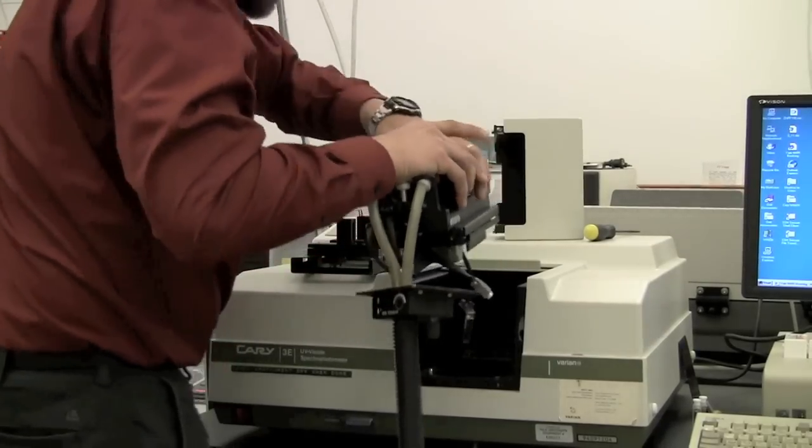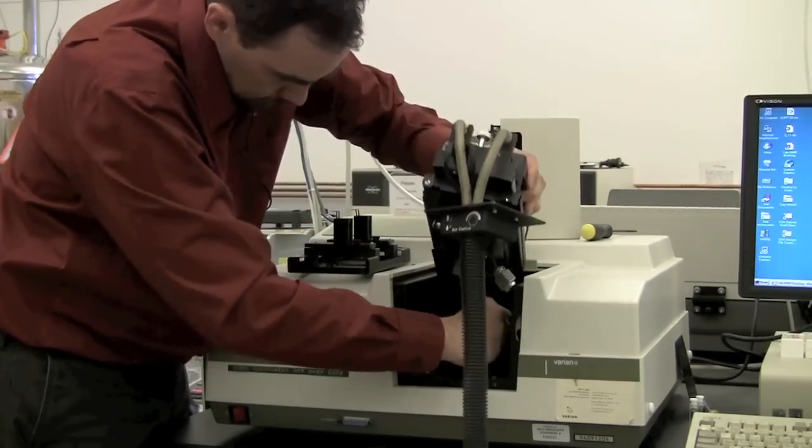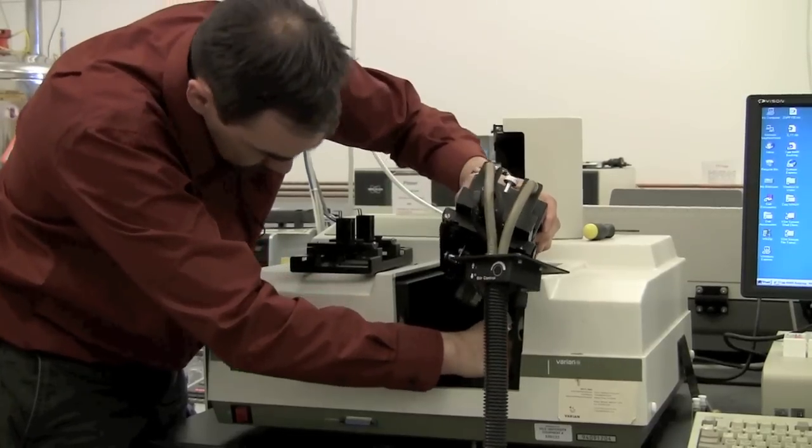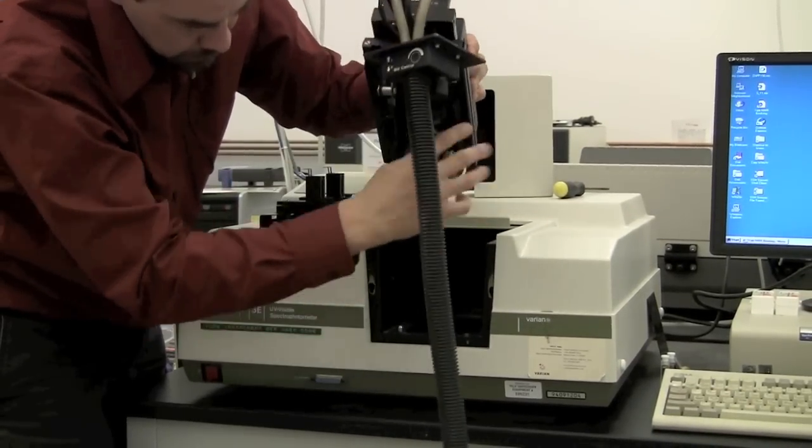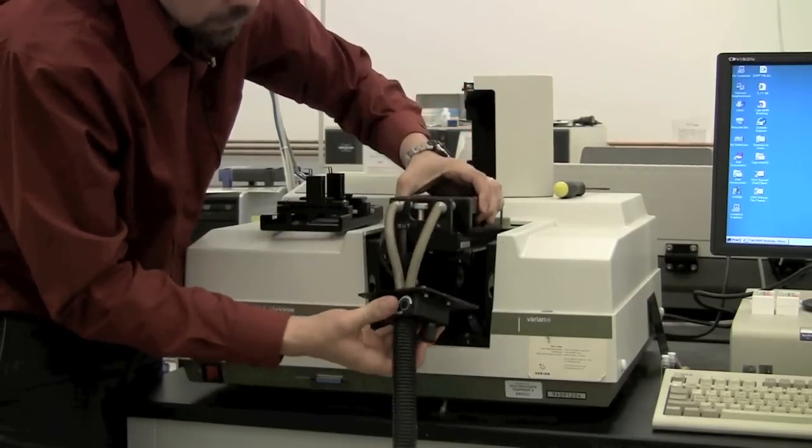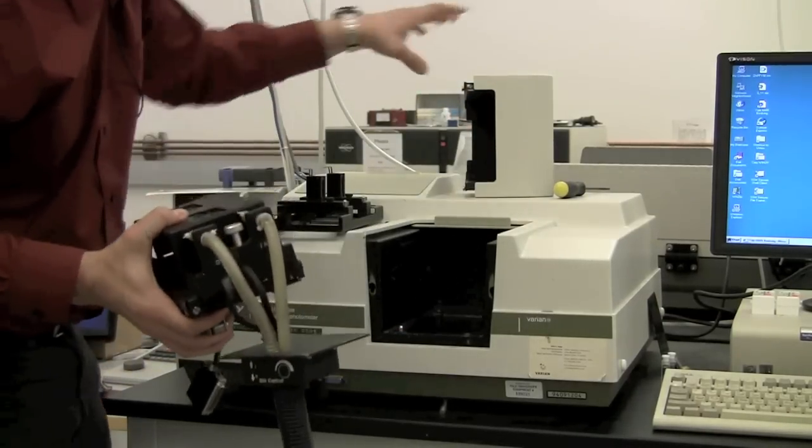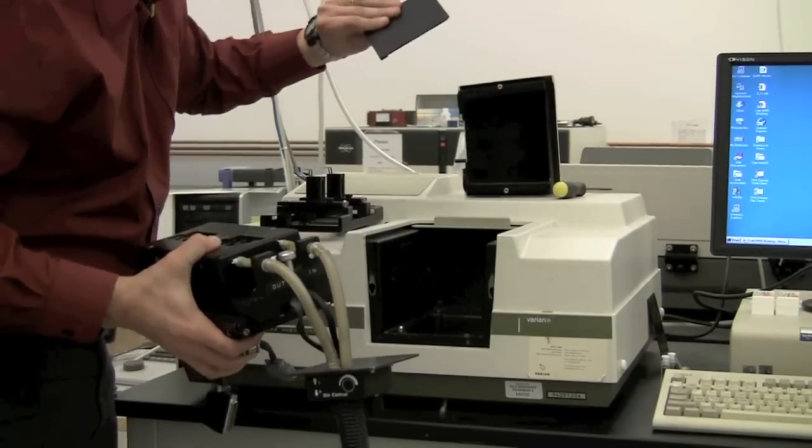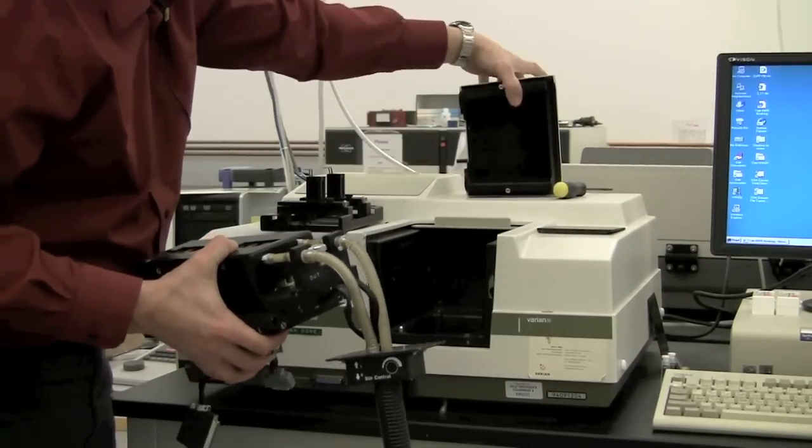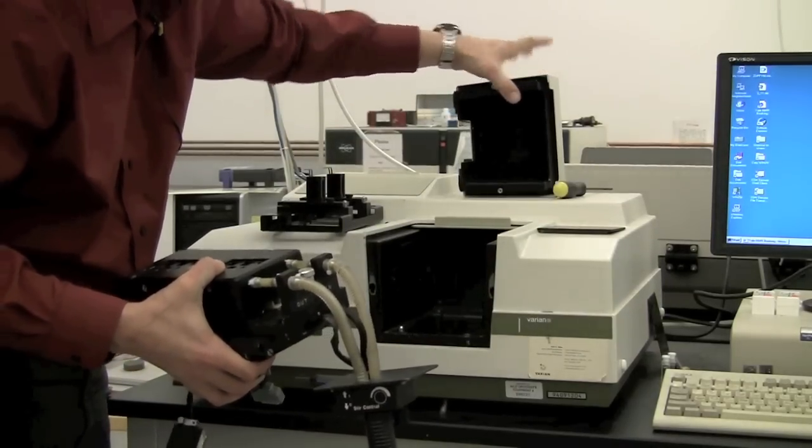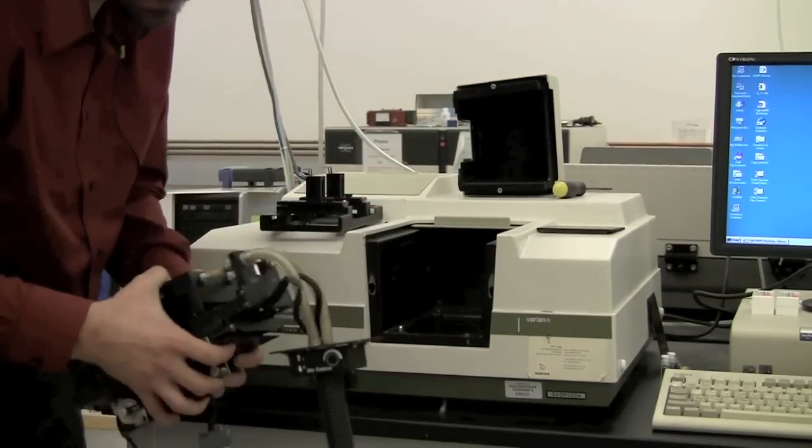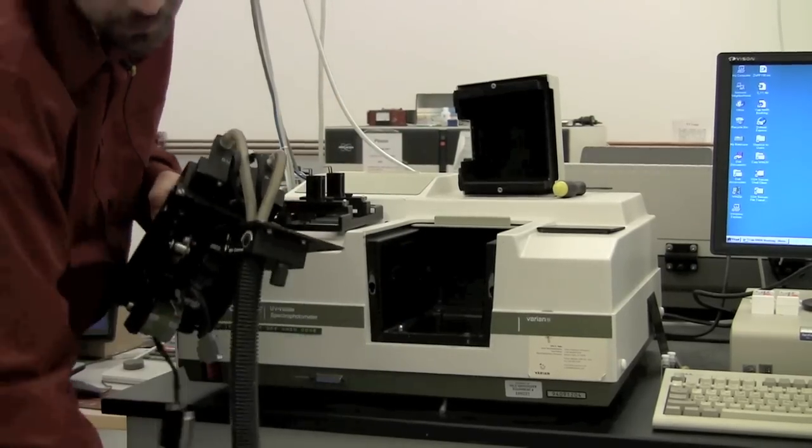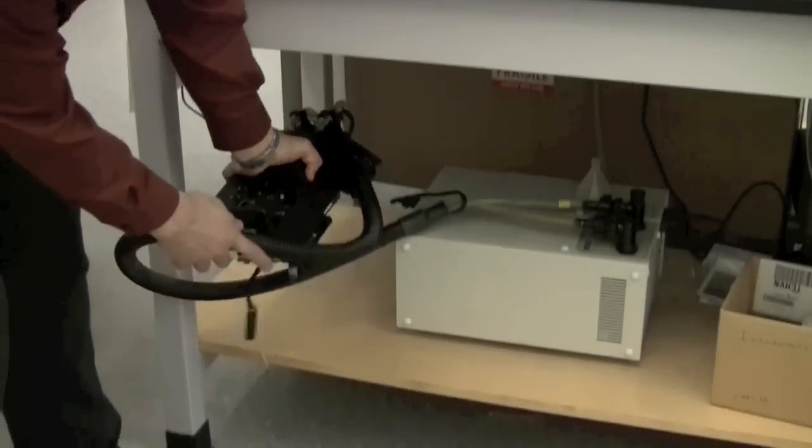As you're loading this in, you need to attach these cables here on the bottom. It's a little bit difficult to do, but it is possible. There's a large one that goes on the large plug and a small one that goes on the small plug. This plate here goes in place of this removable plate to allow the water circulator to pass in and out while still blocking the light. I'm not going to load this at this time, but if you have any questions, you can talk to Instrument Center staff about how to install this accessory.